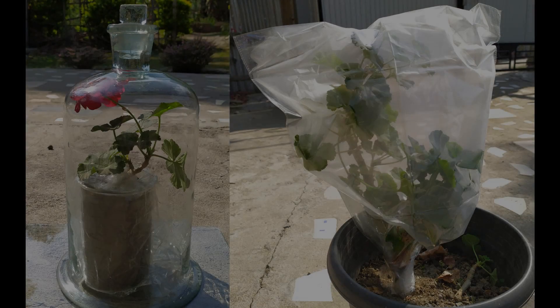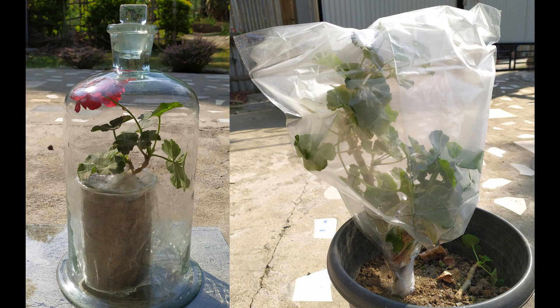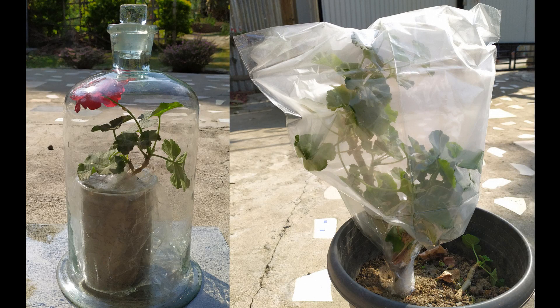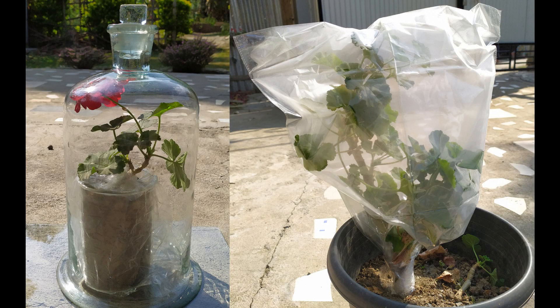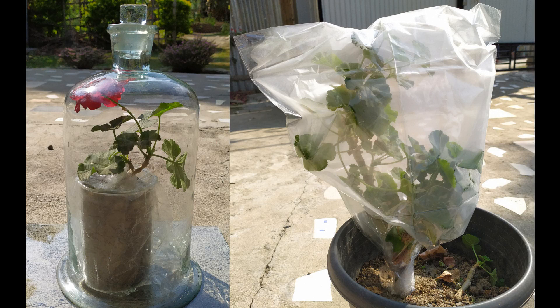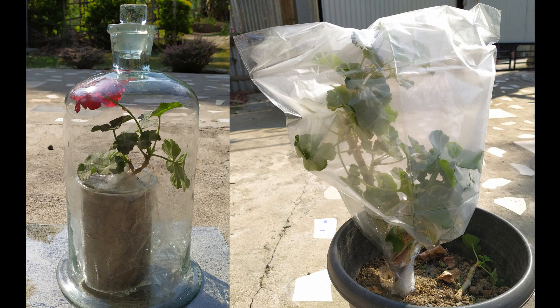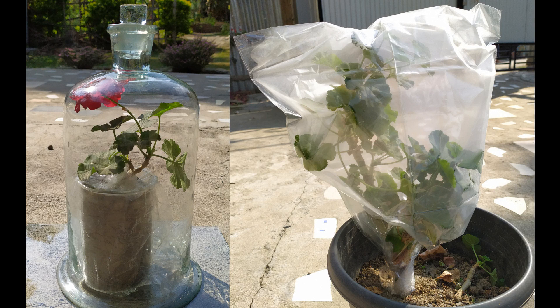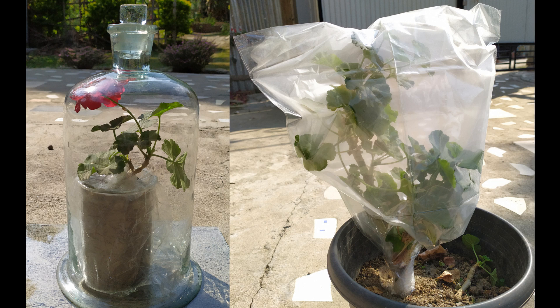The phenomenon of transpiration can be demonstrated using a simple experiment. There are two methods you can use for this experiment: the plastic bag method and the bell jar method. In this video, I'm going to show both methods. You may choose one of these two to perform your experiment.